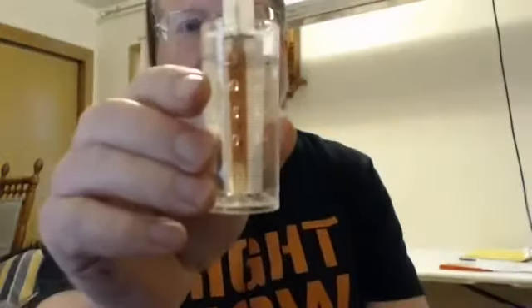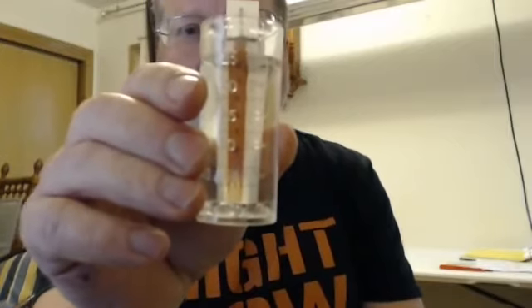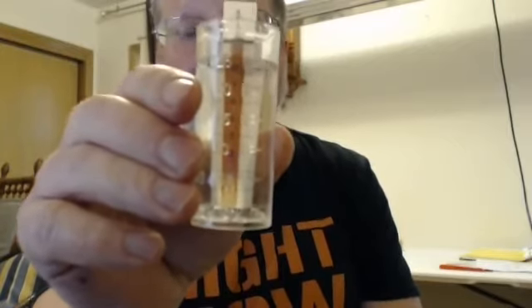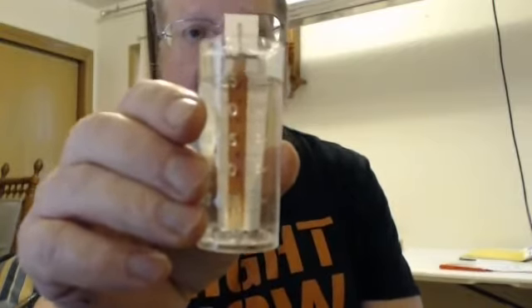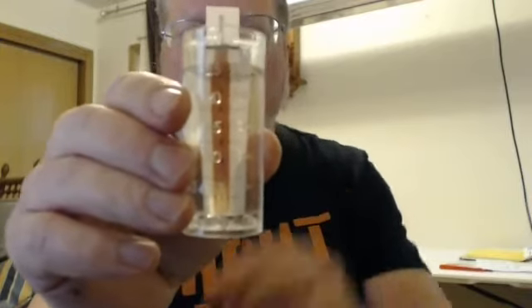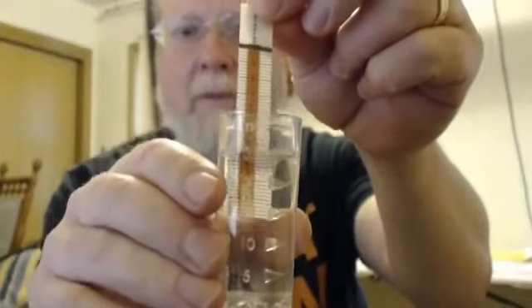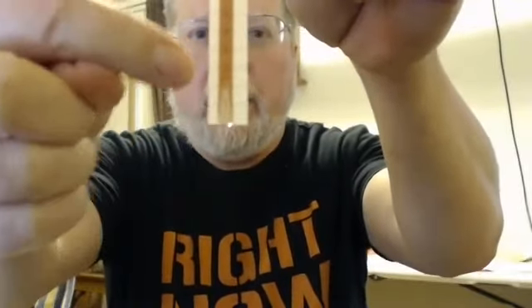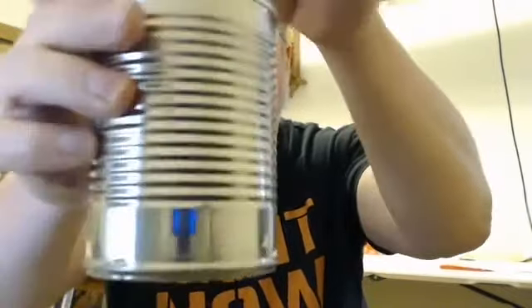Coming back to our test for chloride, often going to be in streams as a result of road salts that have been spread in the winter. We do tend to get peaks at times of snow melt. The black tab is fully developed. And the fun thing down here is you now see this white area that comes to a point. And that is coming to a point at the 2.2 level. I can throw the tab in my little garbage can.